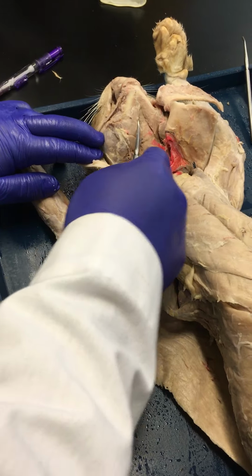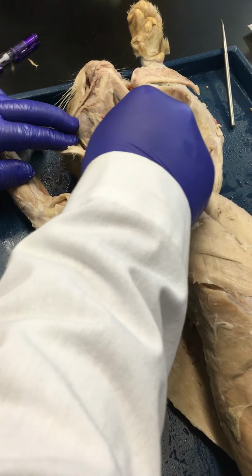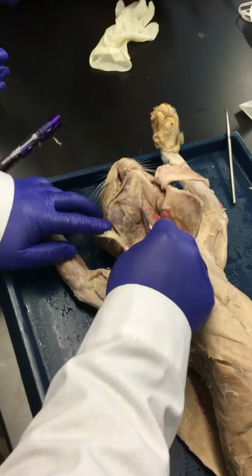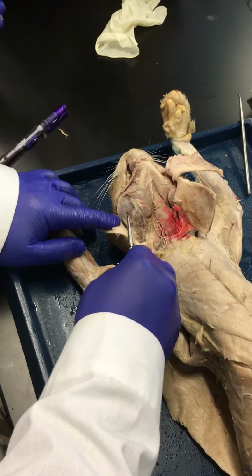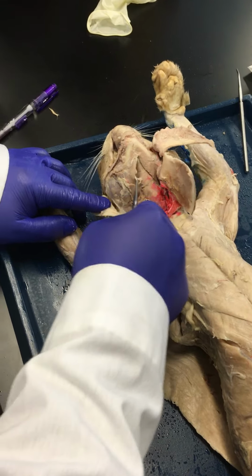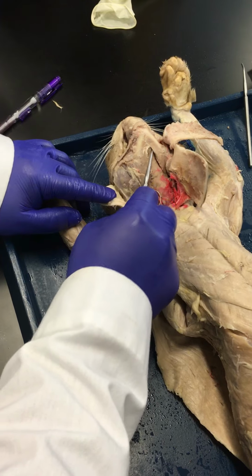Let's make our way down towards the inferior aspect of the jaw. Here you see your two digastric muscles. Right, so the digastric muscles are going to be antagonists to the masseter. The action for these muscles is going to be to depress the mandible. Right? Depresses the mandible as in opening the mouth wide.